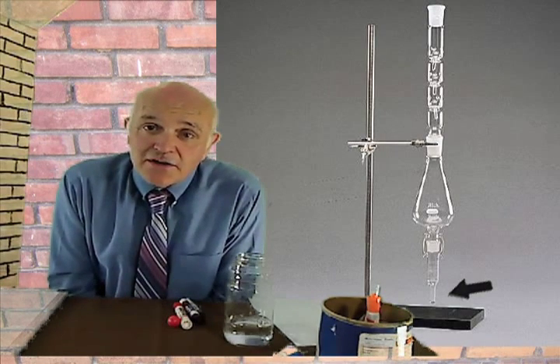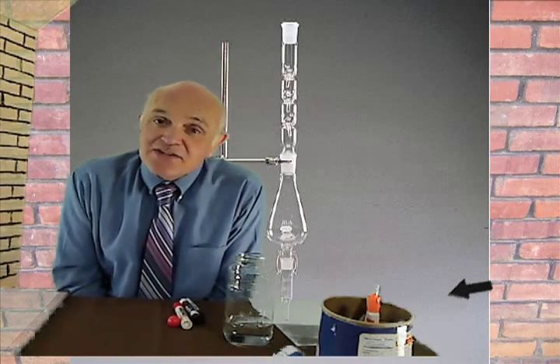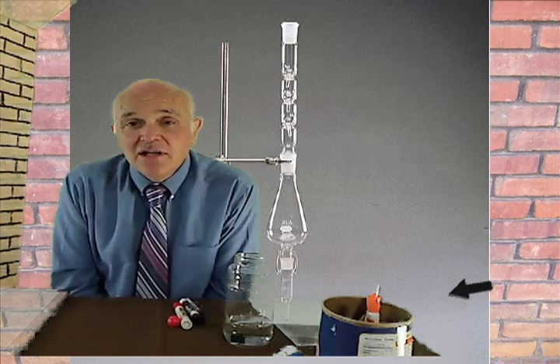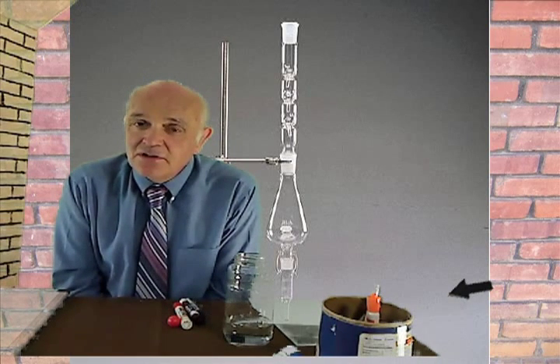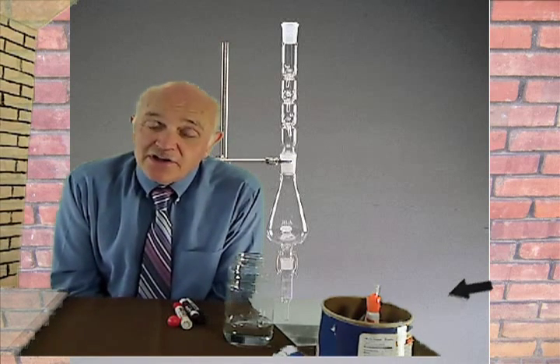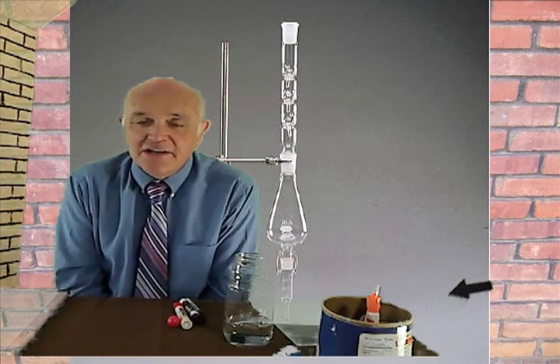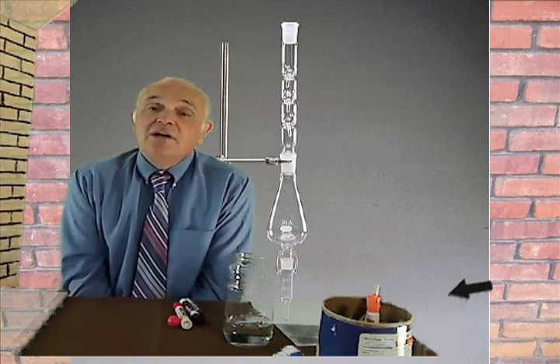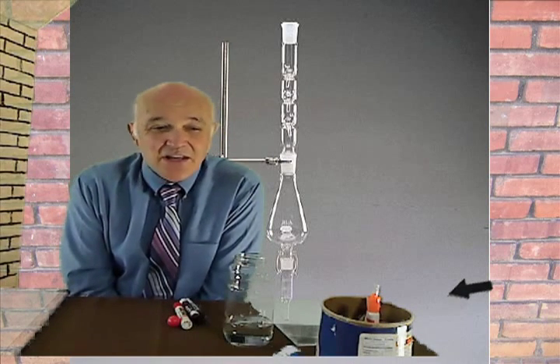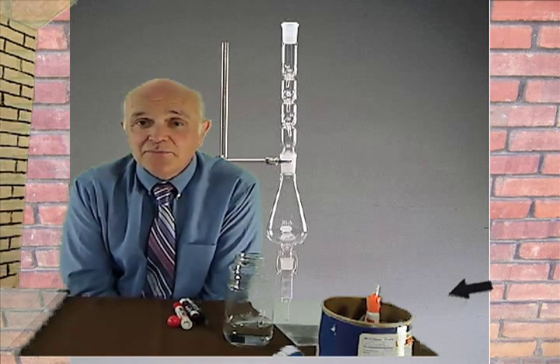The glassware is cleaned, yeah. Is it scrubbed? Yeah. The glassware is put in a furnace and heated up to about maybe 800 degrees, and the furnace burns off all the organic material. So it's cleaned and scrubbed and all that kind of stuff, but not really. It's actually put in a furnace and burned down to nothing. It's gone. It's not clean, it's like sterilized of organic material. The Danish concentrator, which is the 3 pieces of glassware, they cost about, I want to say, $150 to $300. They're pretty expensive. They last a long time if you're careful with them.